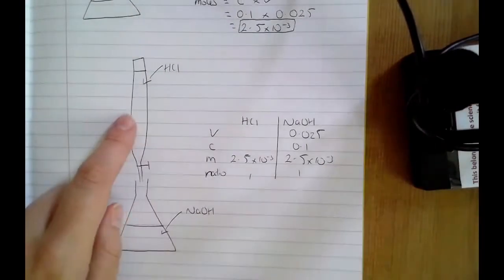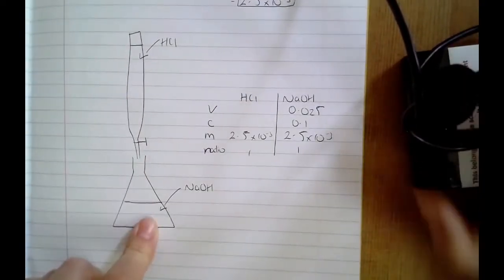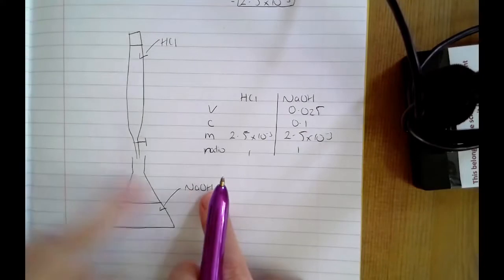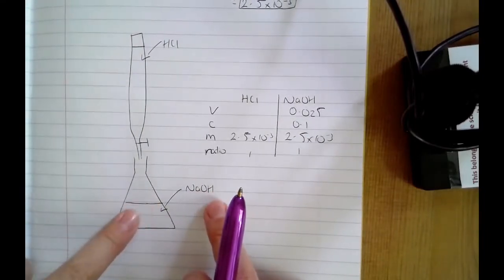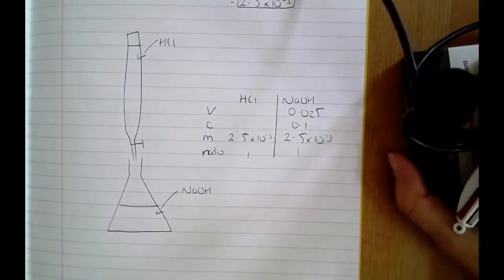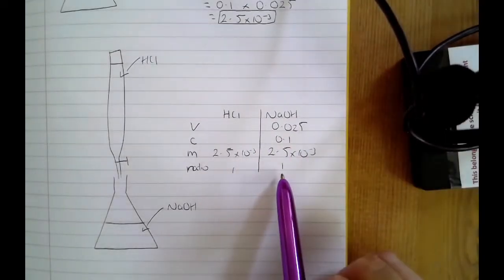And then what I'm going to do is take my unknown solution, which in this case is the hydrochloric acid. I'm going to put my hydrochloric acid into the burette, and I'm going to titrate it against my sodium hydroxide. Now, as I said a second ago, I could do this the other way around. I could have my sodium hydroxide in the burette and my unknown in the conical flask. It doesn't actually matter.